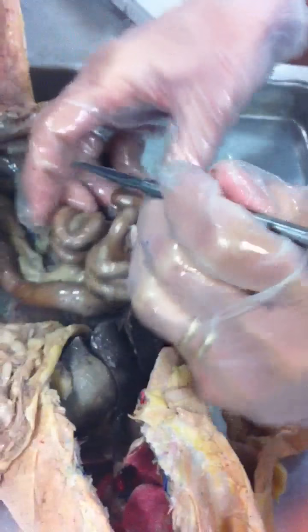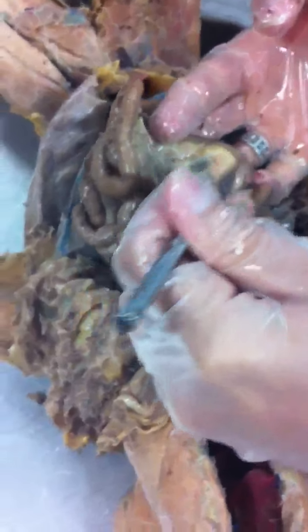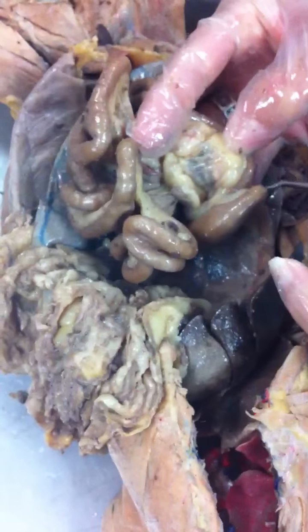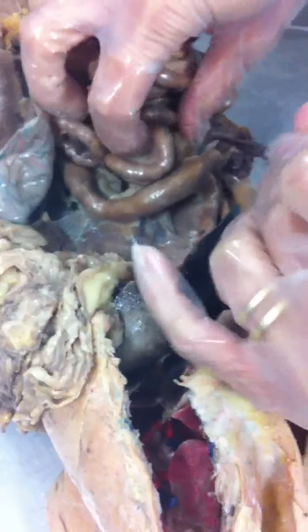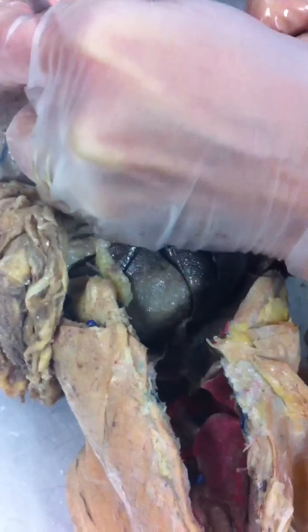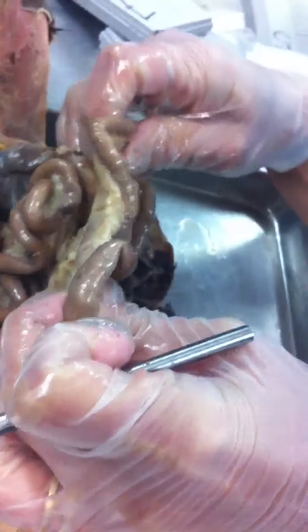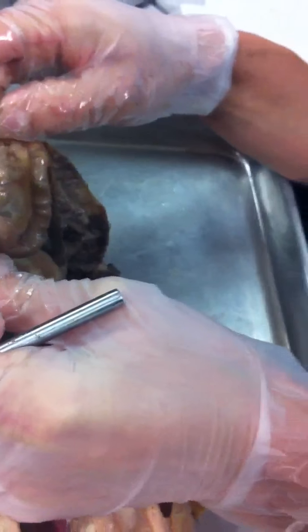Continue to follow the small intestines, and the second portion of the small intestine is called the jejunum. And if we arrange this so that we can see the last part of the small intestine where it combines to the large, this would be ileum, then the cecum. Then going up this side, ascending, then transverse, descending. Do we have to know the sigmoid for this? No. Tissues in between the small intestine, the membrane. Pancreas? No.